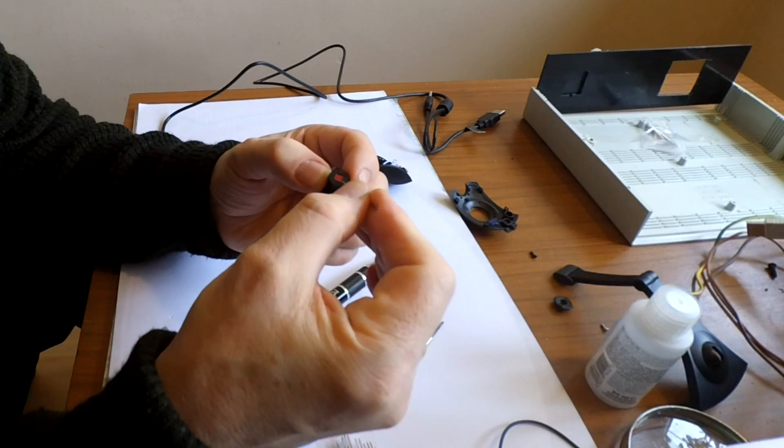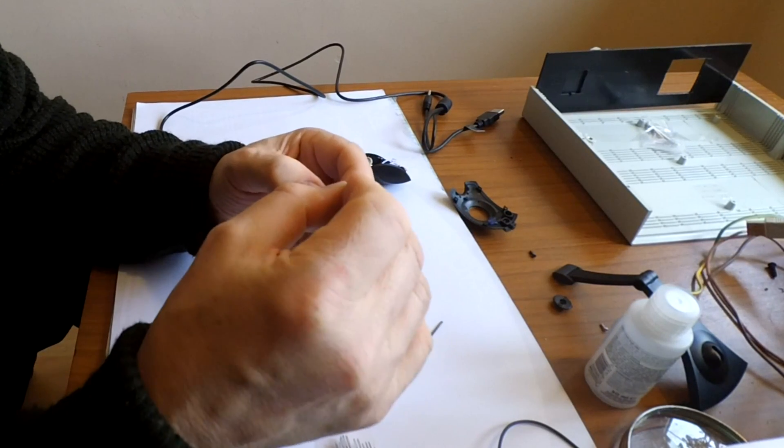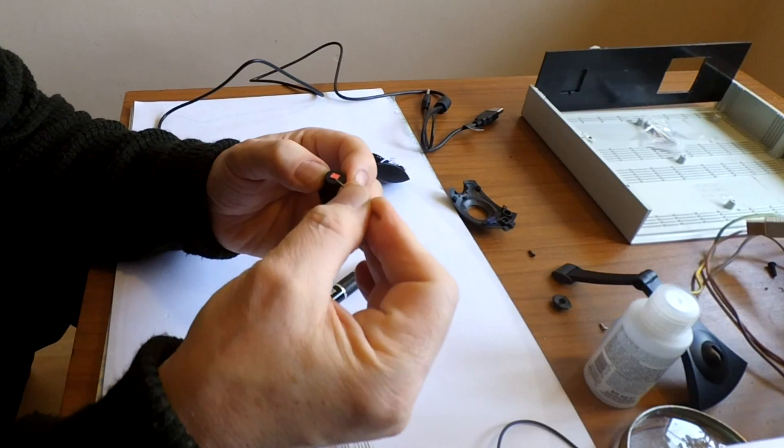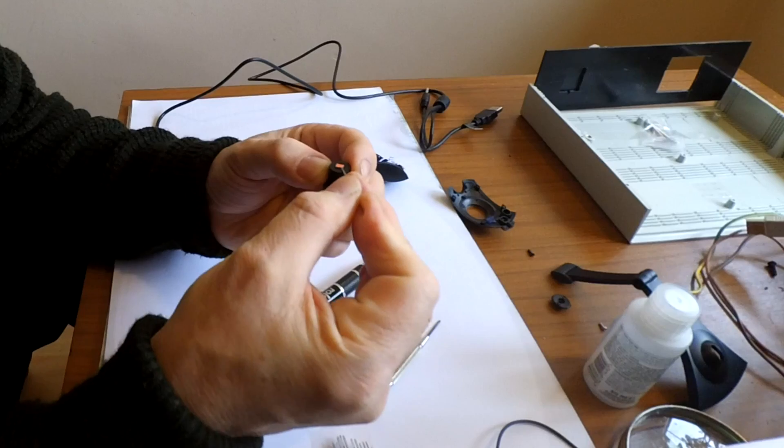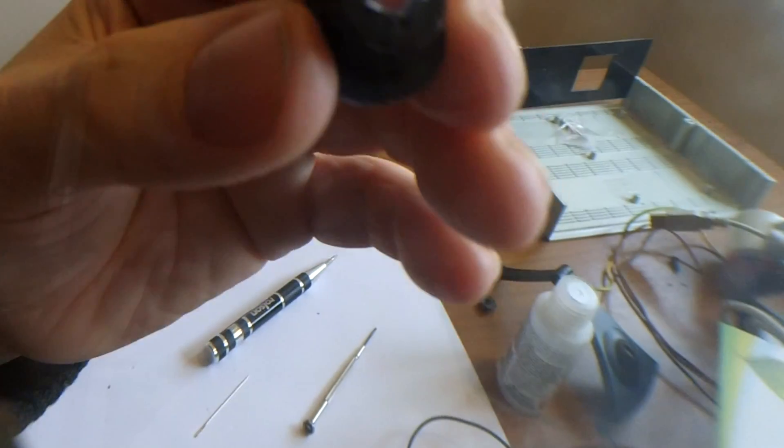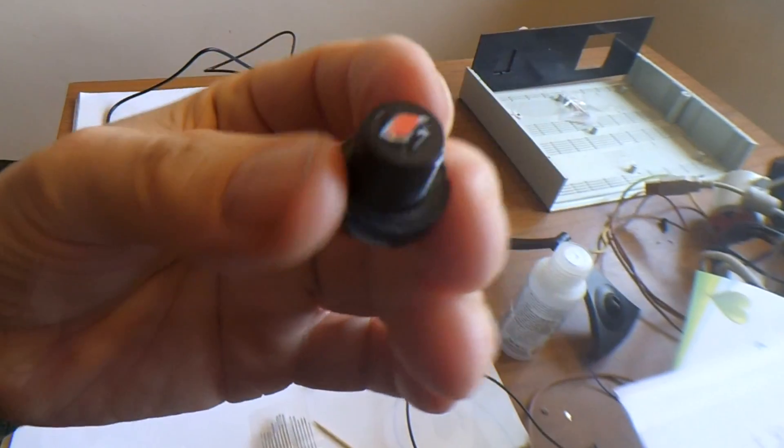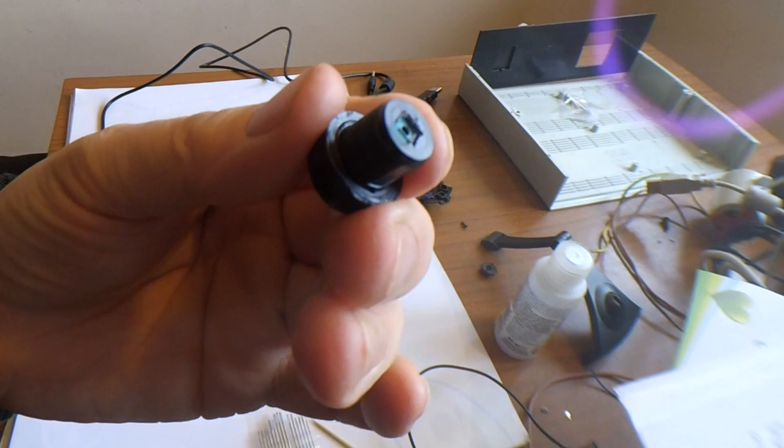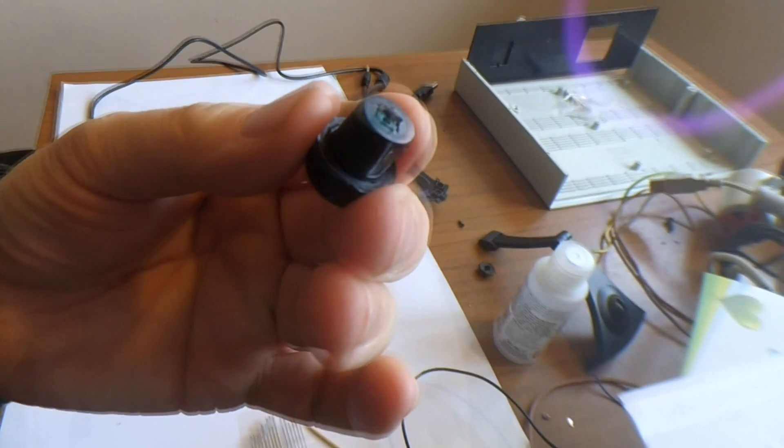Almost made as though it were to do this. Ah, I've got under. Look at that. I don't know if you can see, but I've lifted it as a piece.